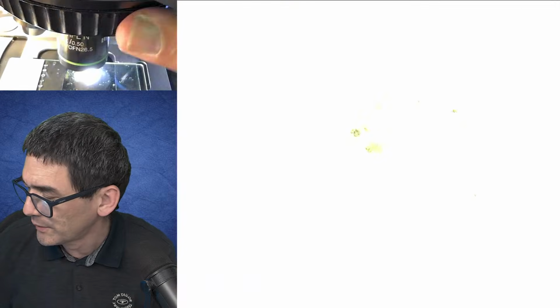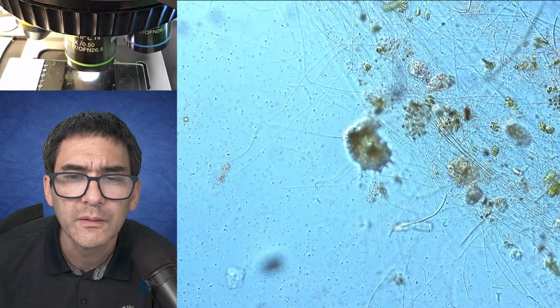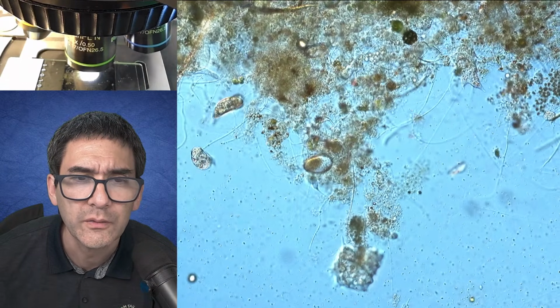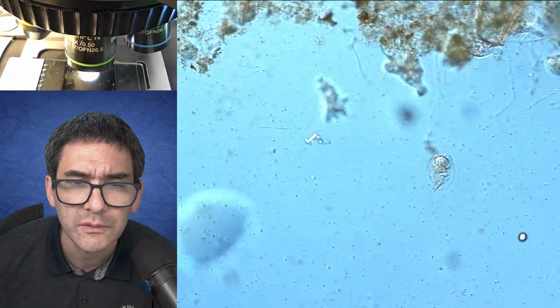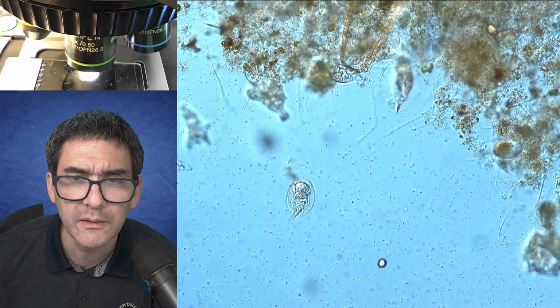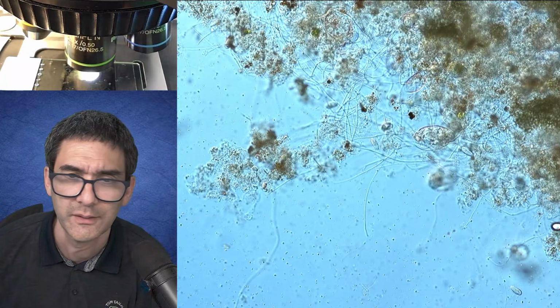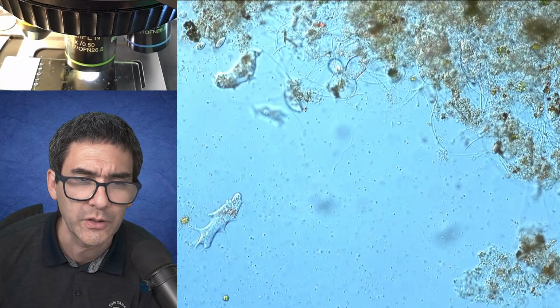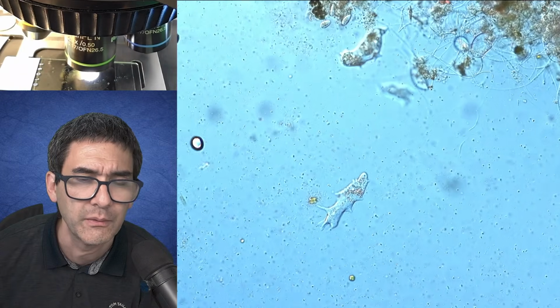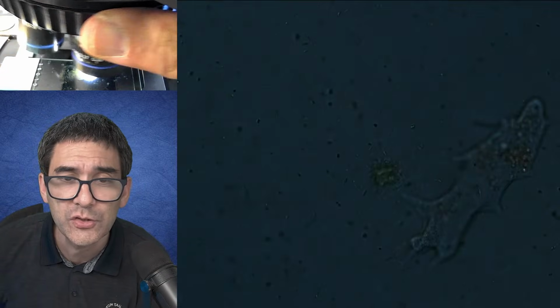So let's go down again. What else are we able to find here? Of course, rotifers. Again, what I recommend is you just gotta try. Every time I've looked at water samples, and if I made an enrichment culture, I found different organisms. It really depends what's present in the first place. So this here is also quite nice and interesting to see.